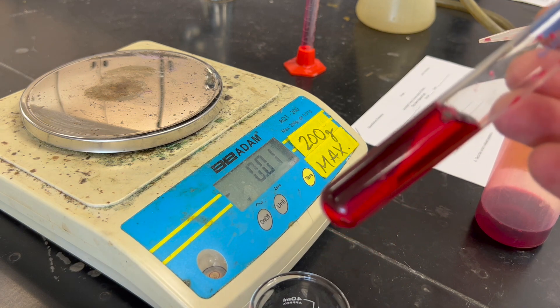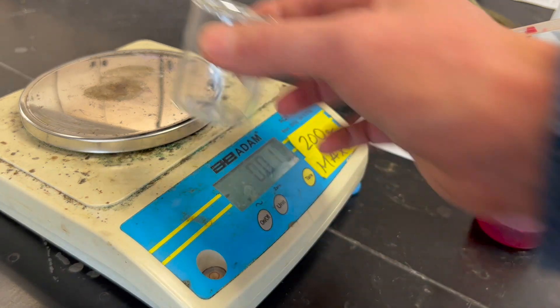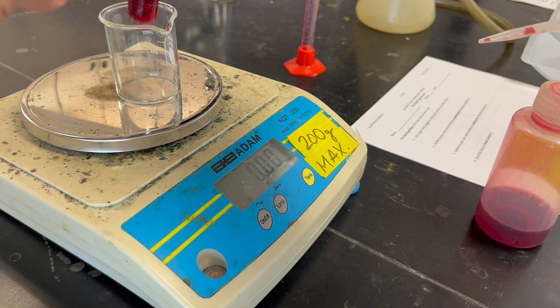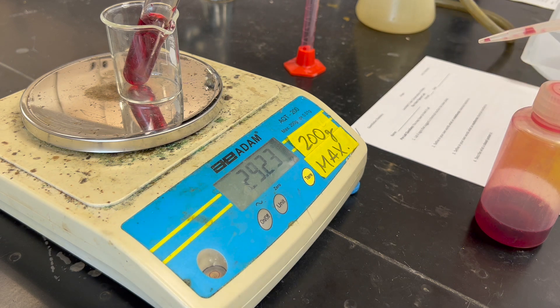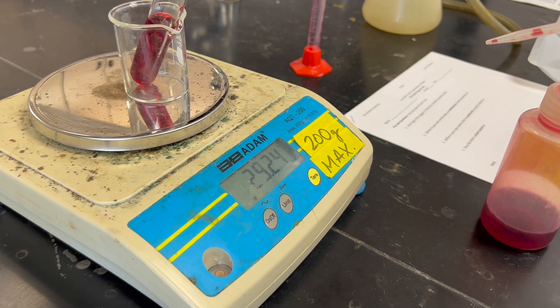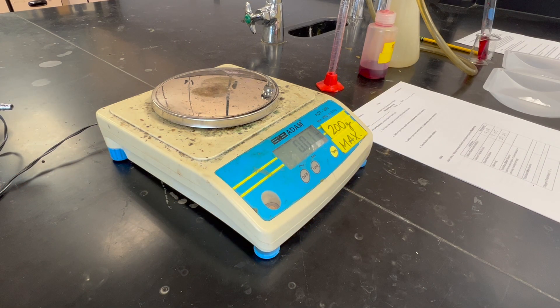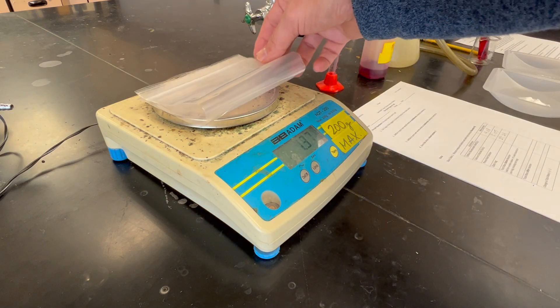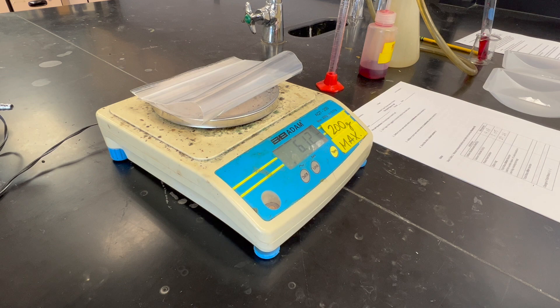Now we're going to weigh the phenol red and the test tube. To do that, we're going to use a beaker as a stand, zero out the beaker, and then record the mass of the phenol red and the test tube: 29.24. We're going to put this down on our data table. Lastly, we're going to weigh a Ziploc bag and also record this measurement in the data table: 6.12.